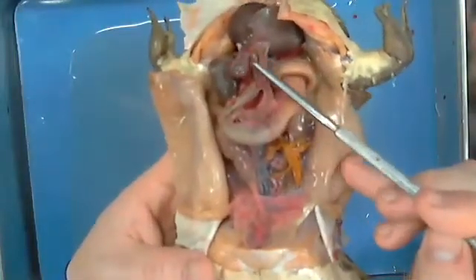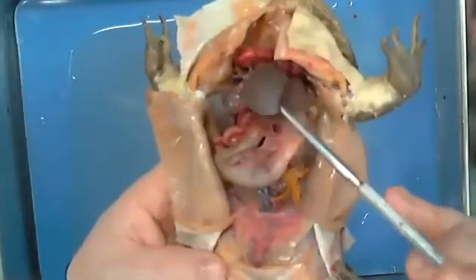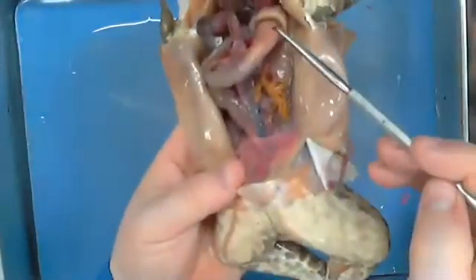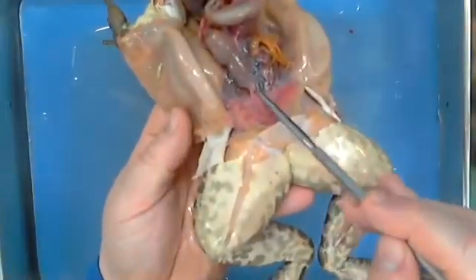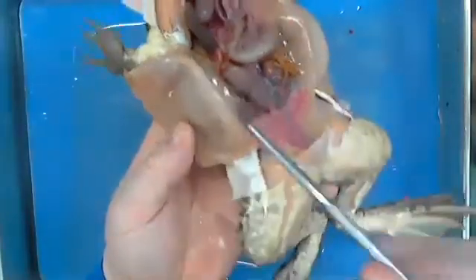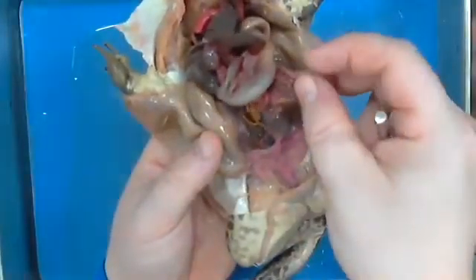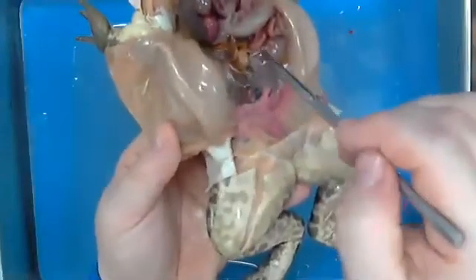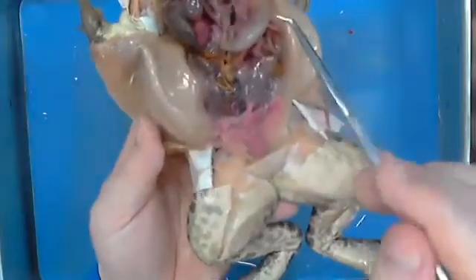This bulb thing underneath our liver is called the what again? Gallbladder. All right, these 3 lobes that are here that are real dark are called the liver. This big thing right here is called the stomach, there we go. This big dark thing that's going out the anus is called the large intestine. All of this corded stuff that's sitting like this is called the small intestine. These brown looking beads that are in here with all these hairs are called what? Fatty bodies. There we go.